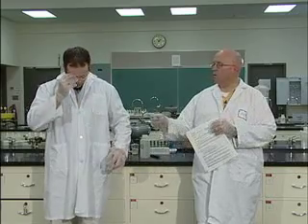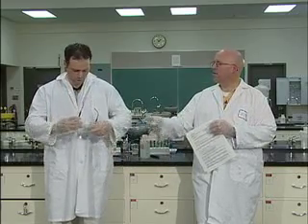And we also get to look at this in context of what happens when the chemical reaction takes place. Exactly. So we get to test and take a look and say, oh, there's something different there. A reaction must have taken place. Exactly, and that's kind of the key to this lab: your observations. Make sure you're writing down detailed observations for every step.